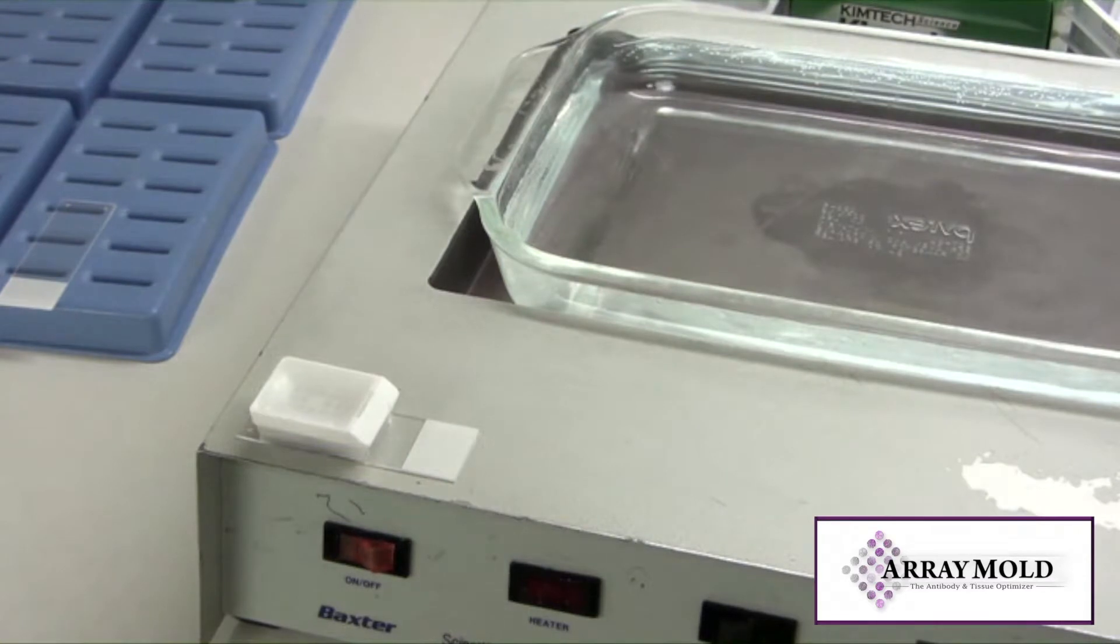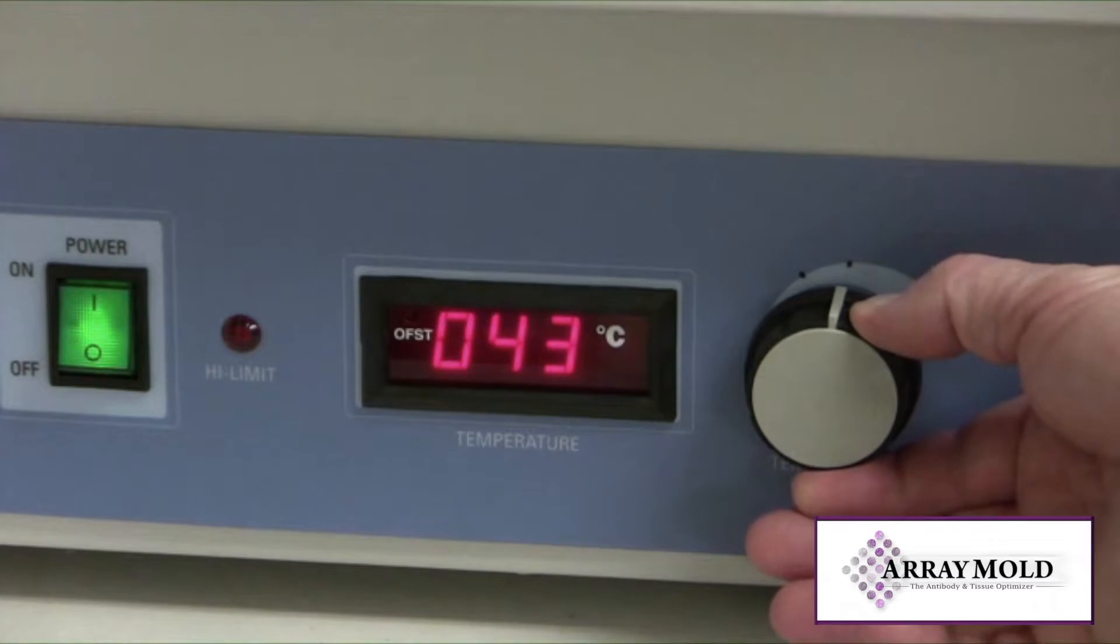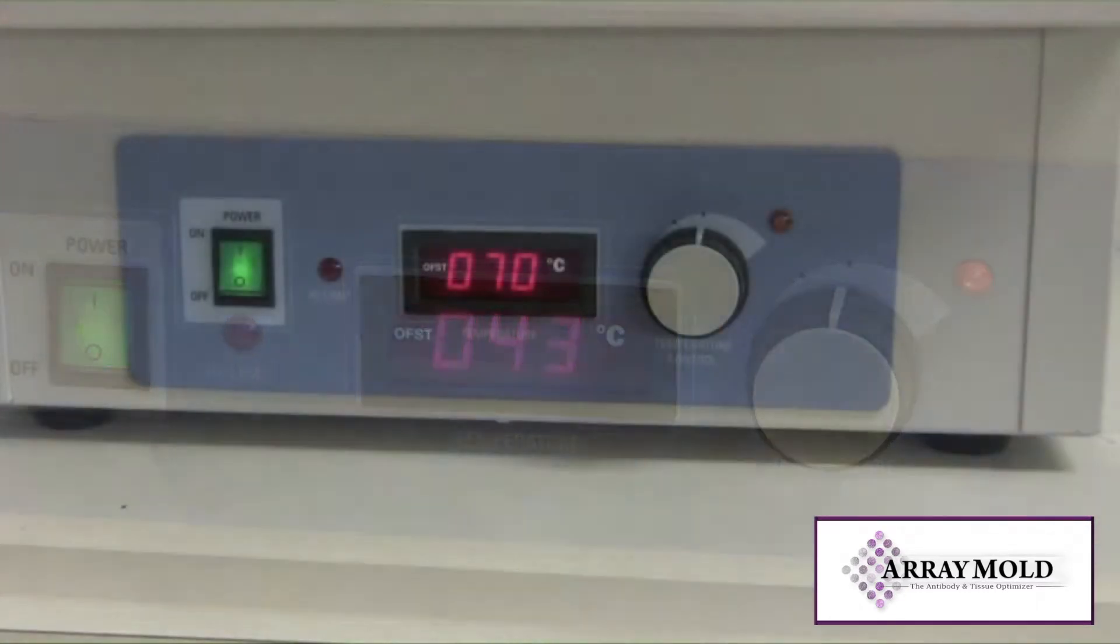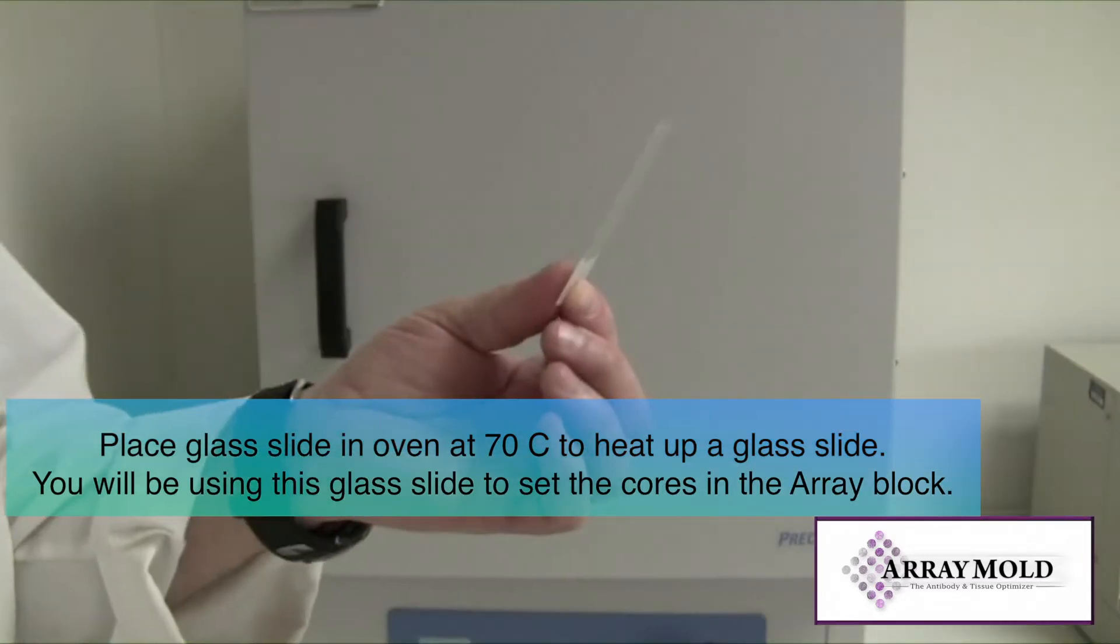Don't put your array block too close to the glass dish. This area is extremely hot and it will definitely melt your block. Please test this procedure with a blank paraffin block and a slide if you are going to use this technique. Make sure it works for you.